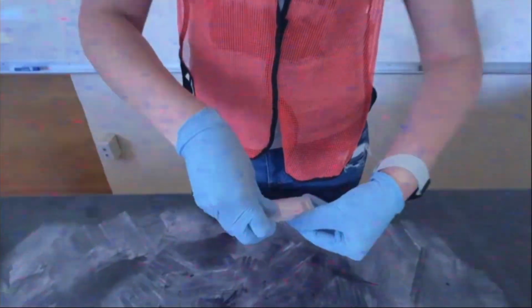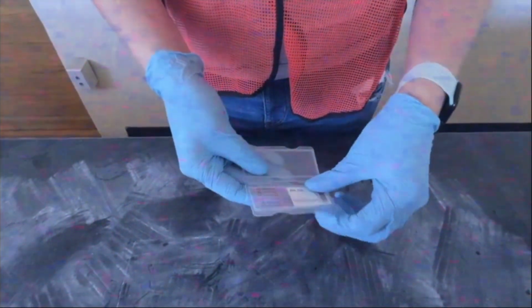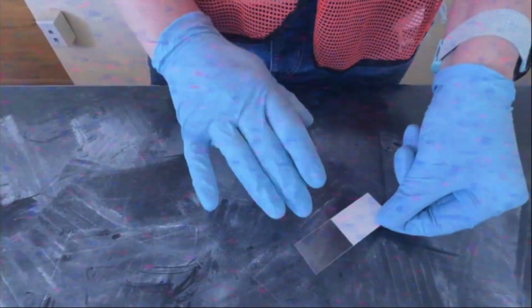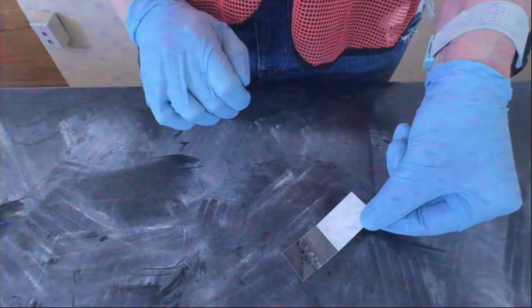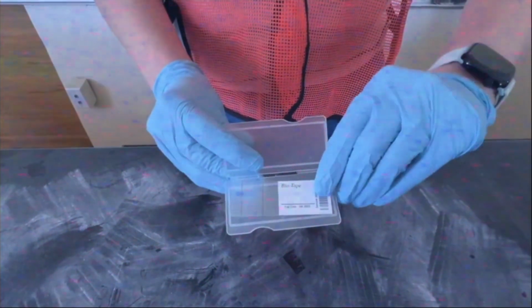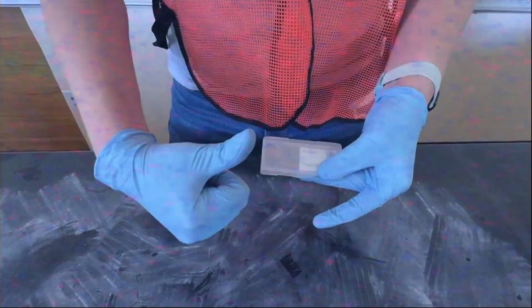Sometimes the industrial hygienist seeks answers that only a tape lift can provide. The tape is gently applied. The tape is gently removed. The tape has completed its mission. The sample is mounted onto a microscope slide and prepared for laboratory analysis.